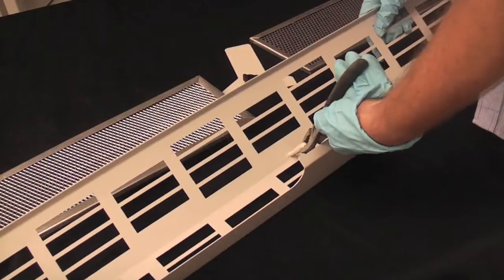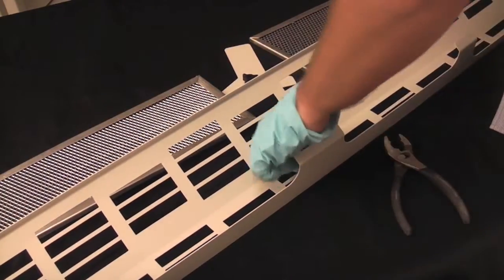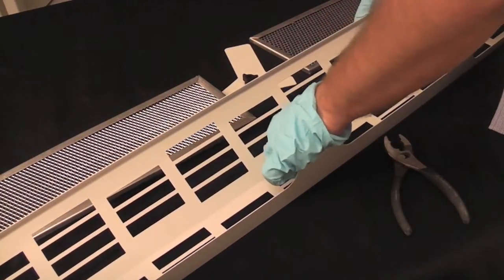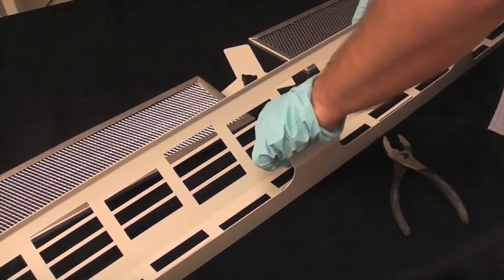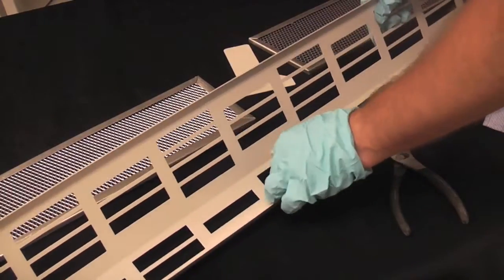Assemble the new towel catch and pre-filter system by placing the pre-filter screens into the new towel catch bracket. Once in place, tighten the thumb screw to lock the top of the screen.